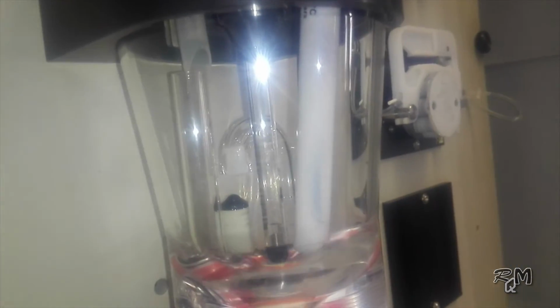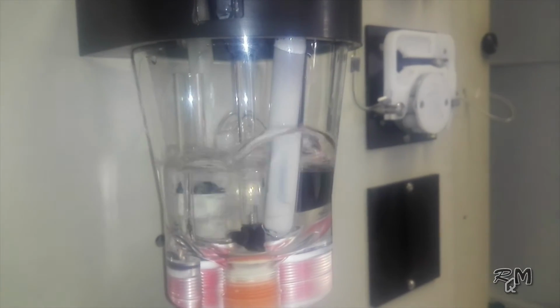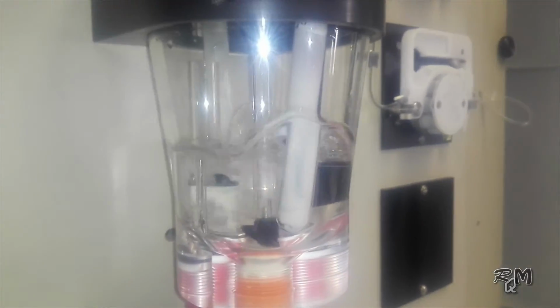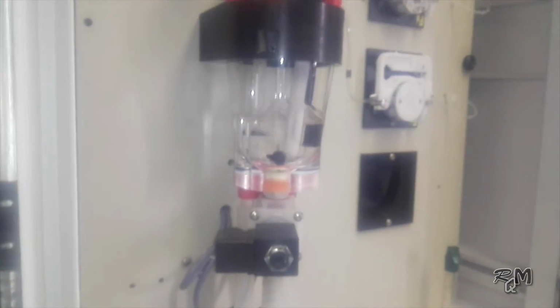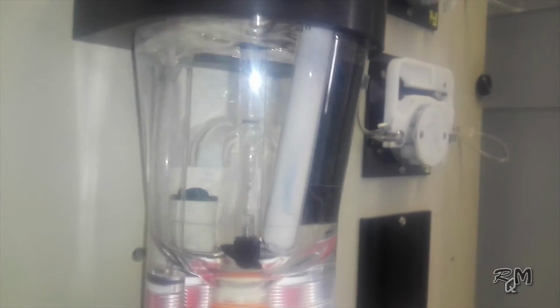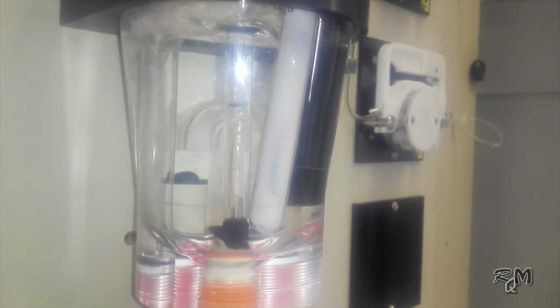It will follow the normal operation sequence. First, the sprinkler will rinse the electrodes 3 times. Then the sample inlet valve will open and the drain valve will drain some quantity of sample for a short time and then close. After this, the sample level rises up to the overflow tube and flows through the overflow tube for a short time.